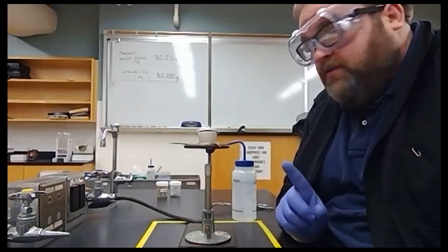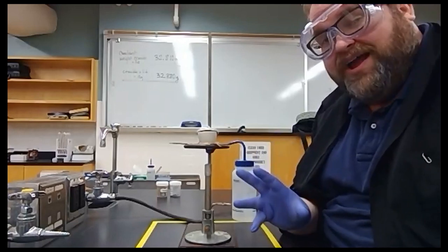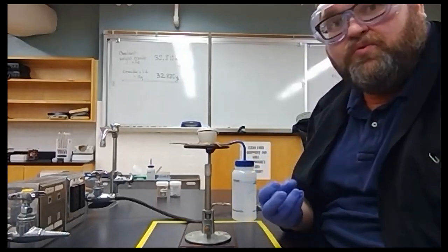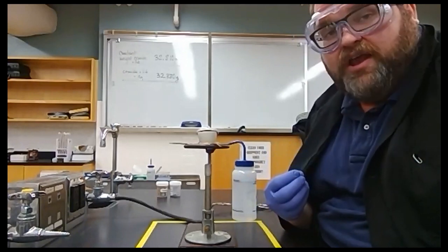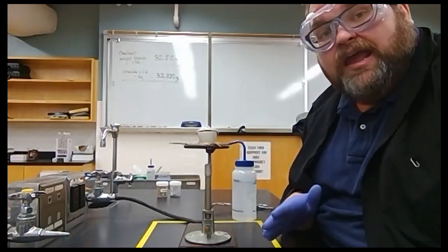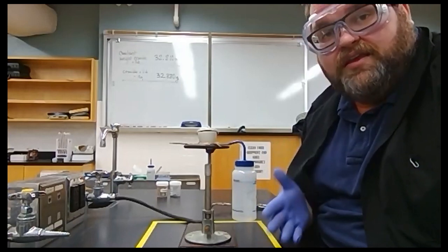We're back. So it ignited, there was a bright light flash, and then a dull little light that calmed down to a red glow. We let that red glow go and go and go until the red glow went out. And when we're done it looked like this.